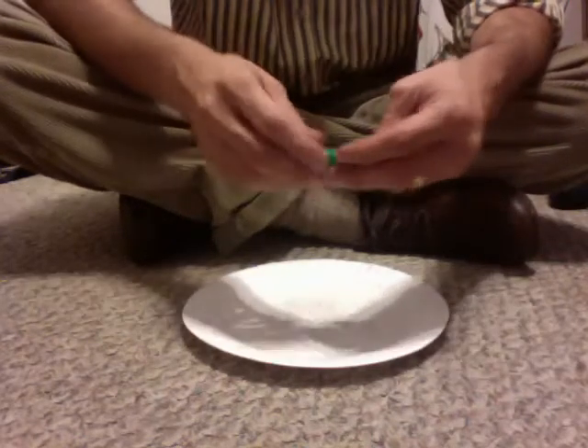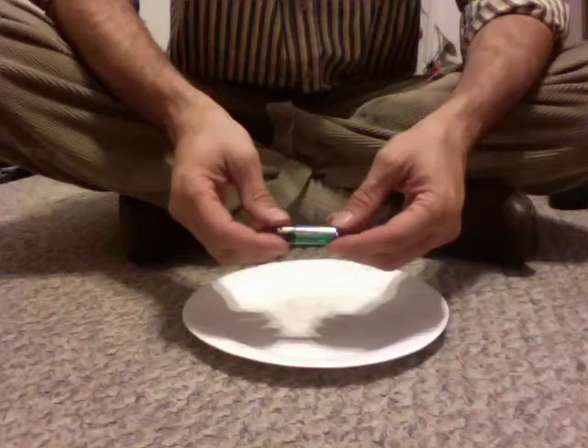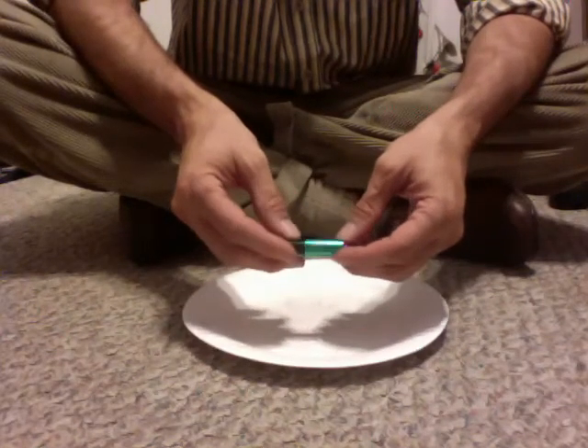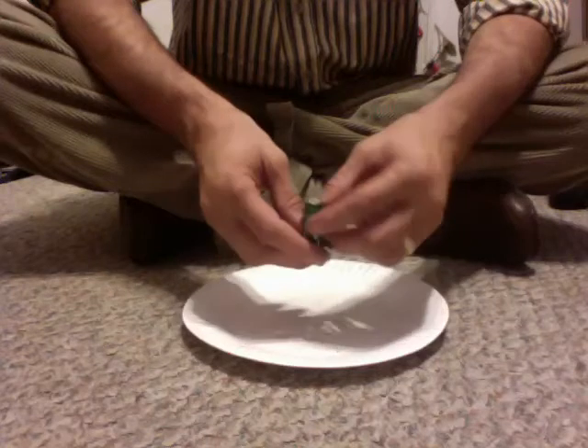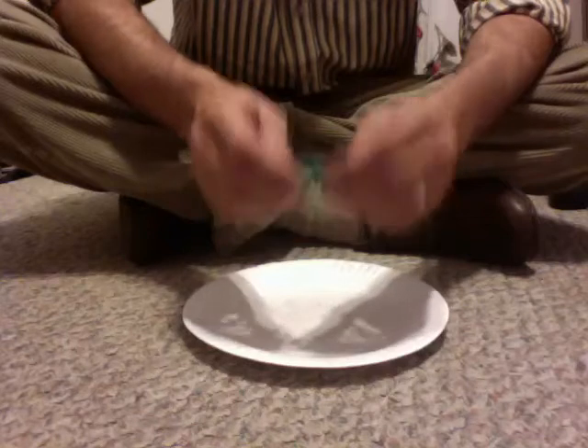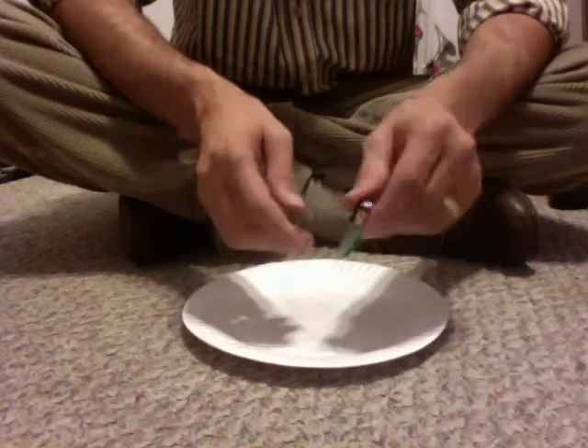Here's another try at showing you how to take apart a heavy-duty battery. Notice 'extra heavy-duty' — this is just a cheap battery, the kind that come with toys because they don't want to spend a whole bunch of money on you. It's not an alkaline battery. It's a heavy-duty battery.